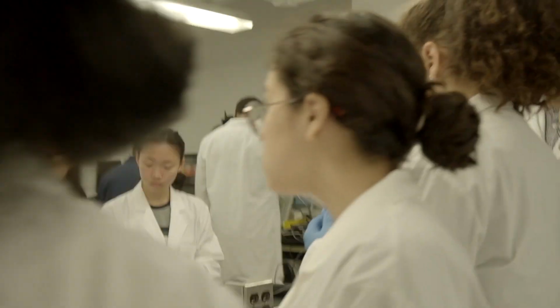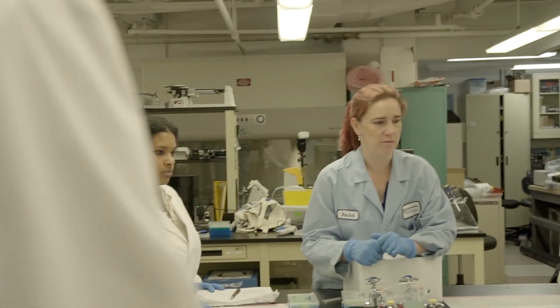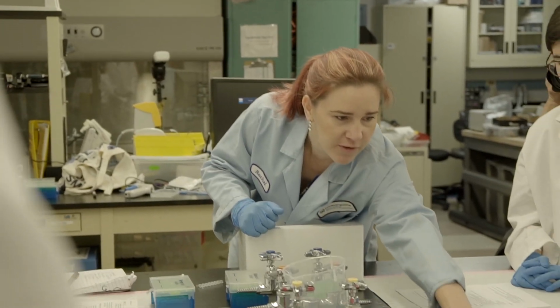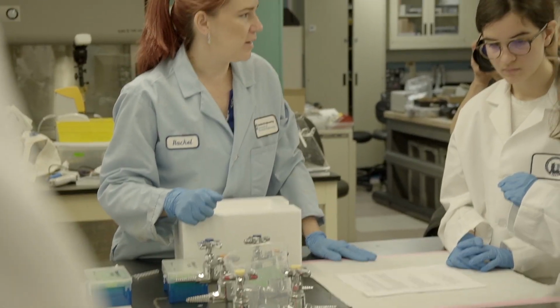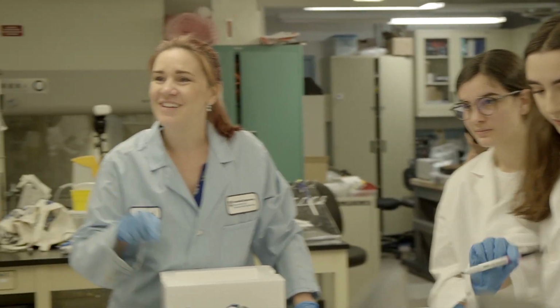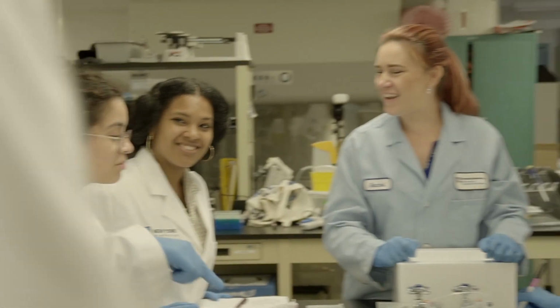We have the lab pen, right? So why don't each bench pick a letter that's going to represent your group. So what letter do you want? A. And why don't you just write it up here so we don't forget? And what letter do you want? Give me any letter. B. All right. D. Okay. I'm waiting.